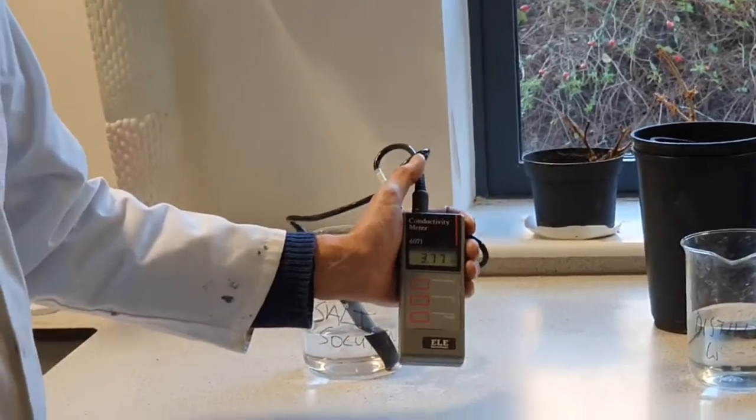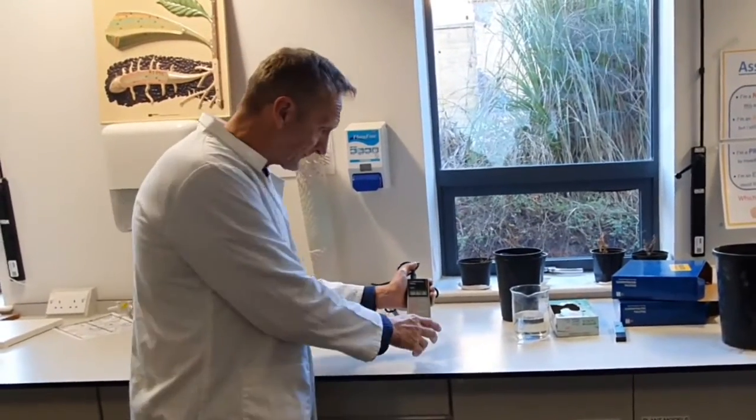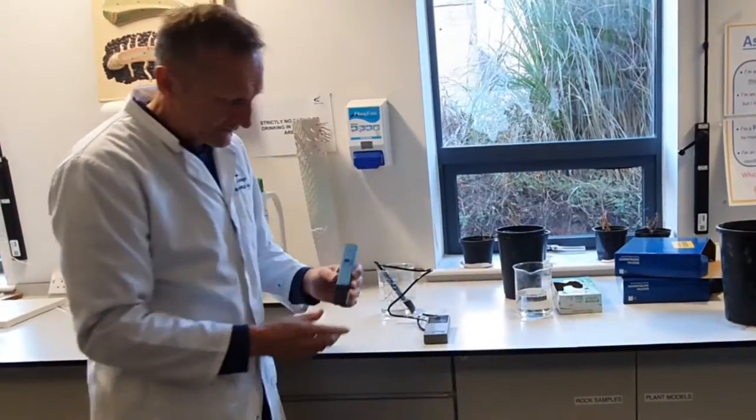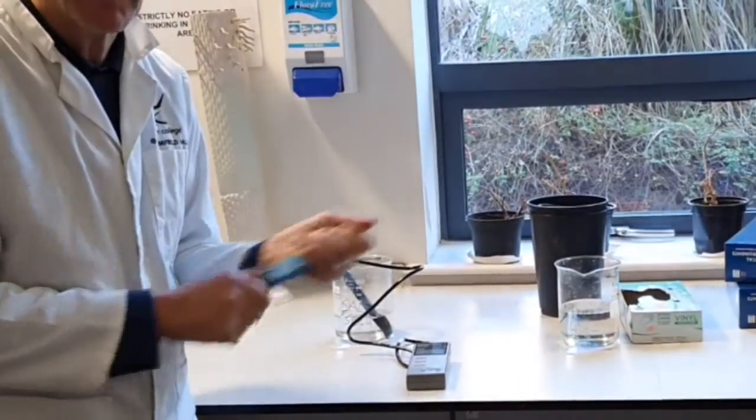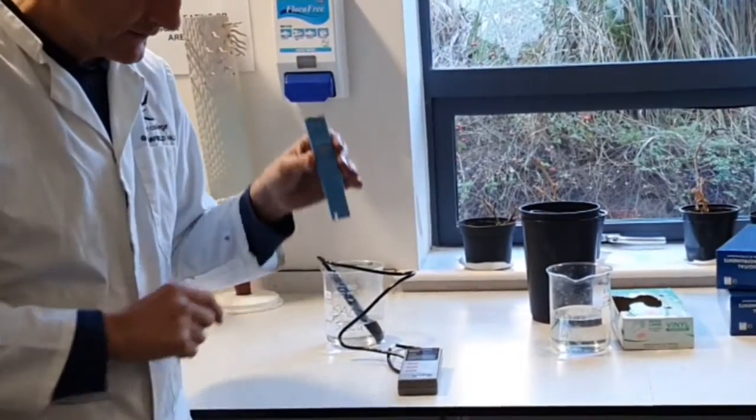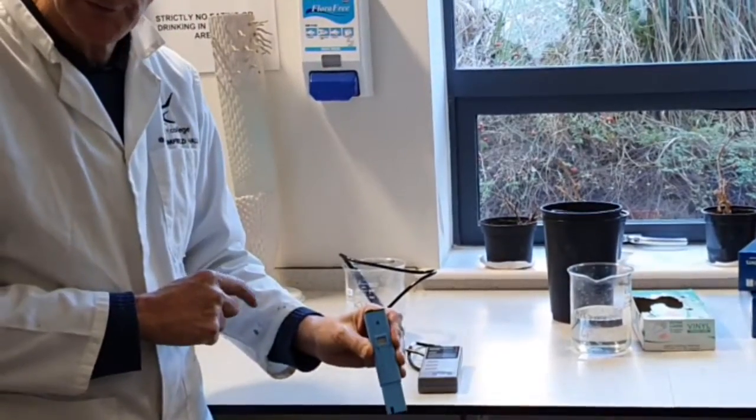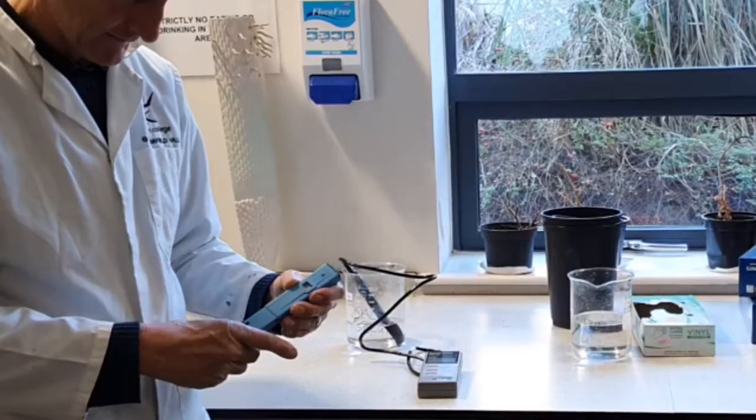That's your reading. There are different types of testers. You can buy one like this with a switch on the top. You take the bottom bit off and put that in the solution—this one doesn't have batteries so we can't demonstrate—but it will give you a reading, same kind of thing.